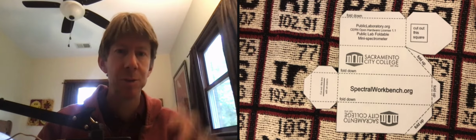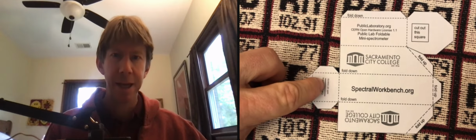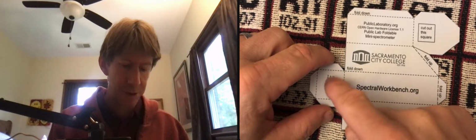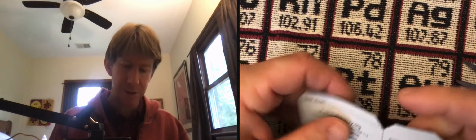And then there's actually two more places you have to cut it. You have to cut out this square and you have to cut out this line. And this one says to use an X-Acto blade, which if you do, be careful and make sure you don't cut anything under it. But I'm just gonna use a pair of scissors. Got my pair of scissors here. And to do that, let's do the easier one first.